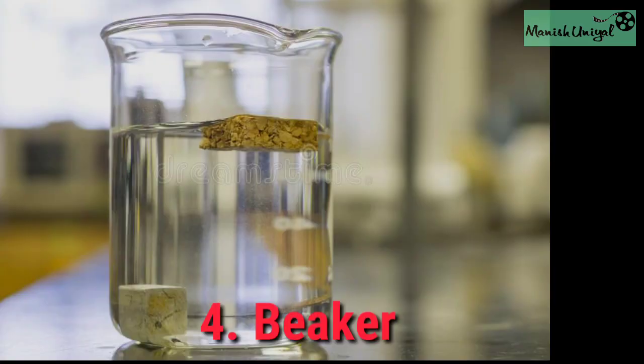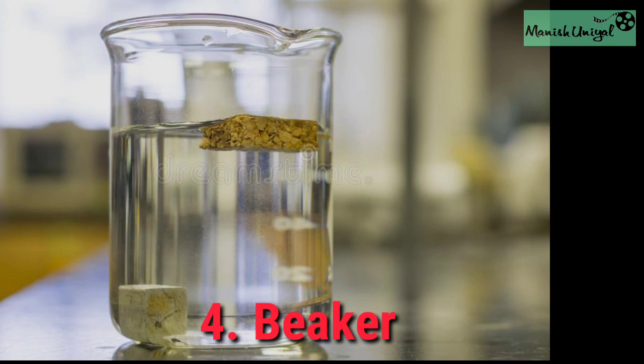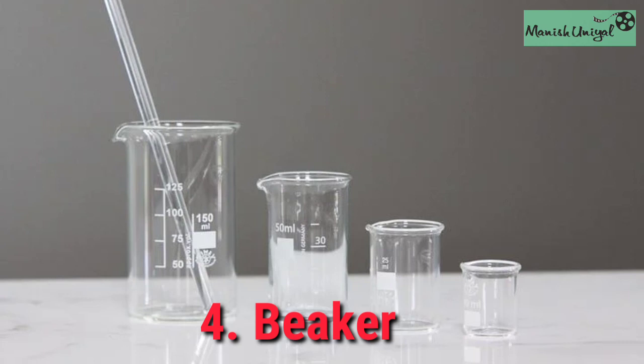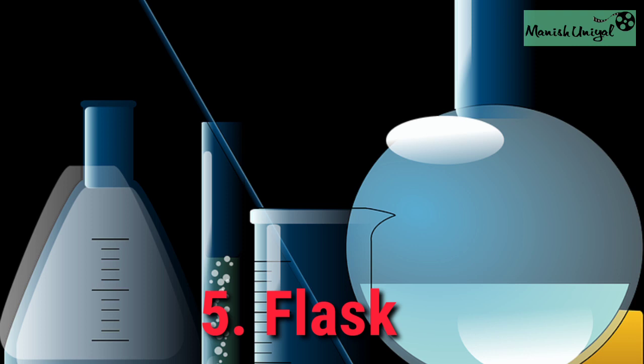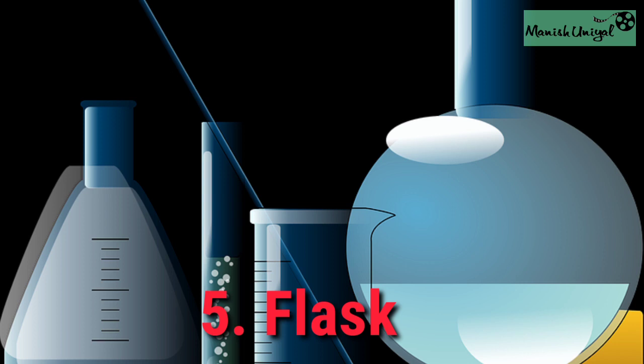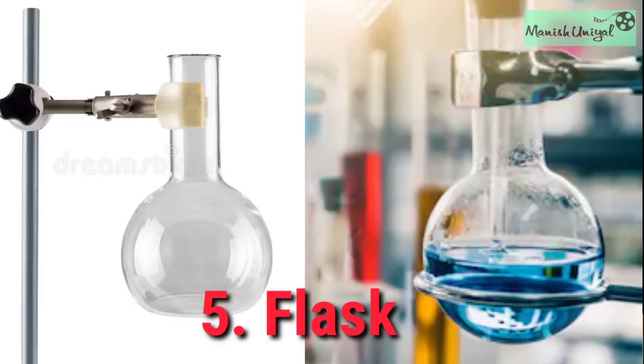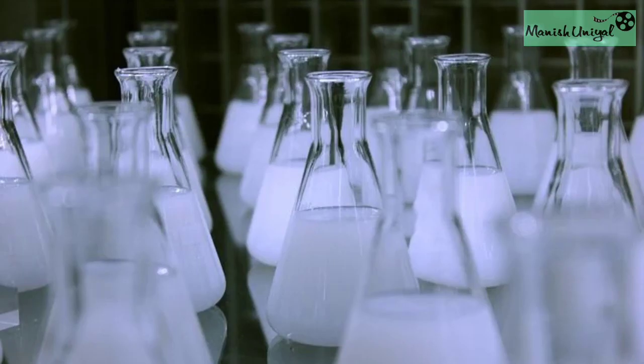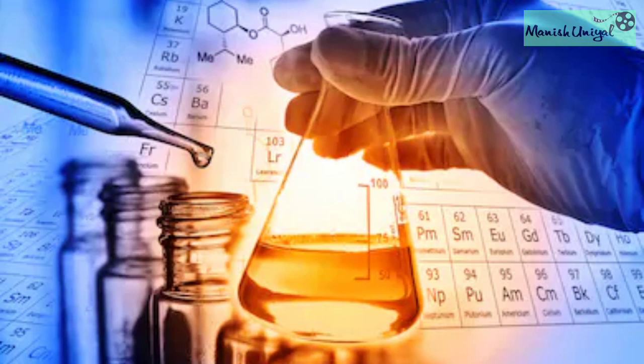Number four: beaker — made of glass and available in different sizes, used for preparation and keeping of solutions. Number five: flask — made of glass. There are three types of flask that are common: round bottom, flat bottom and conical. Flasks are used during experiments to hold sufficient quantities of substances.